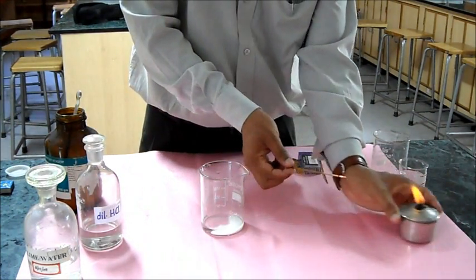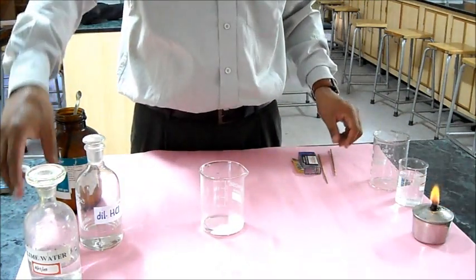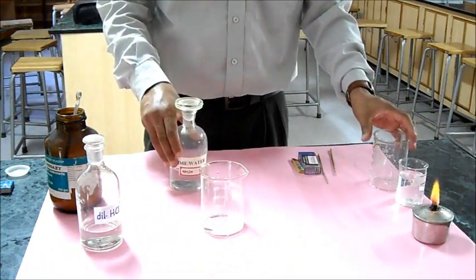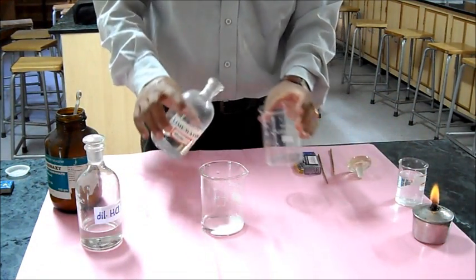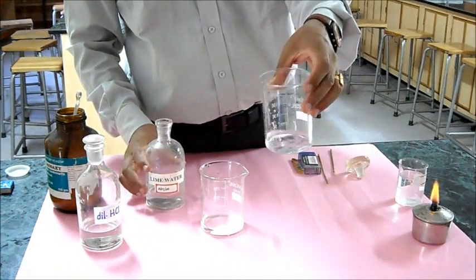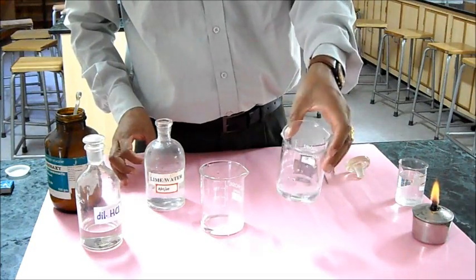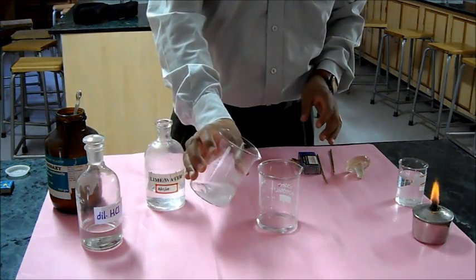The same gas can also be tested with lime water. So we pour some lime water here. As you can see, the lime water is basically colorless.